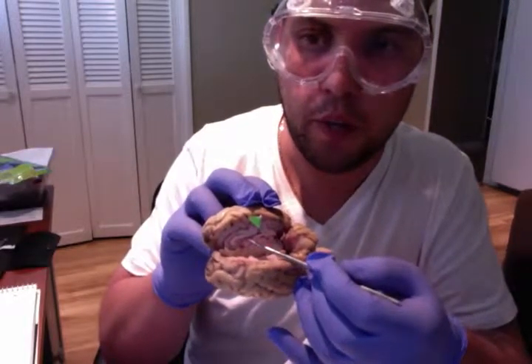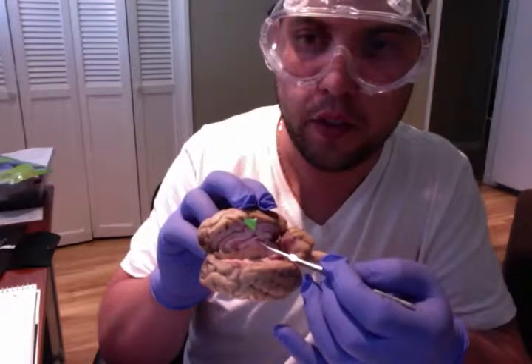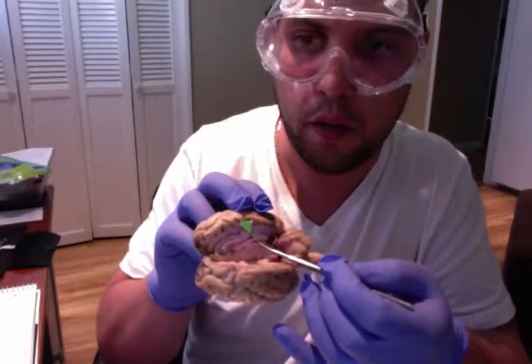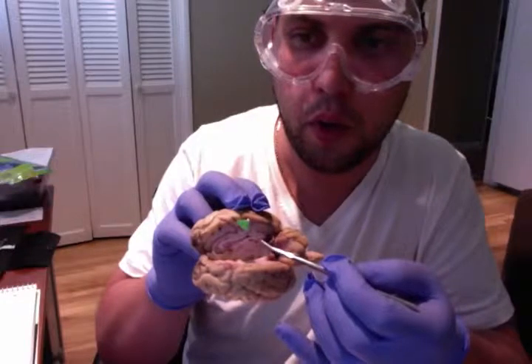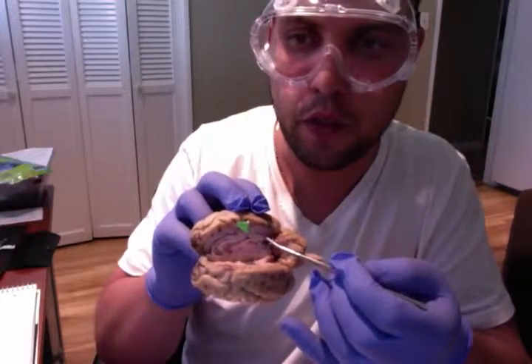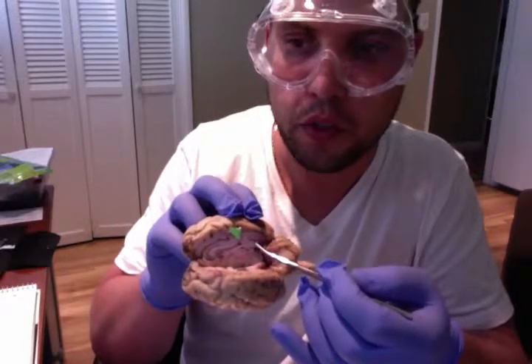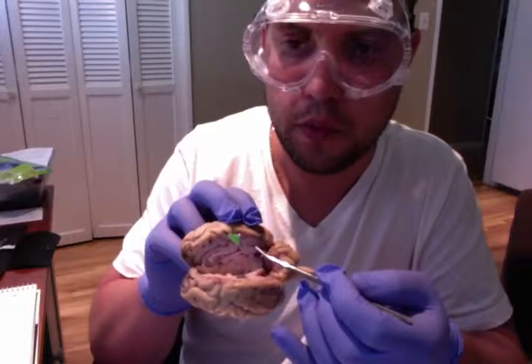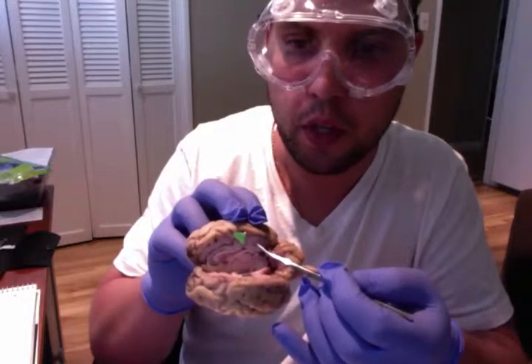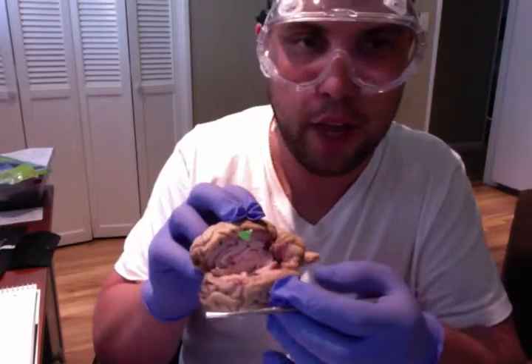We also have the cerebellum with the arbor vitae. The arbor vitae is a tree-shaped, white-colored component found in the cerebellum. It is known for its role in motor and sensory information that goes to and from this region of the brain, which is the center of the body's nervous system. Due to its shape and structure as well as its functions, its name means tree of life in Latin.